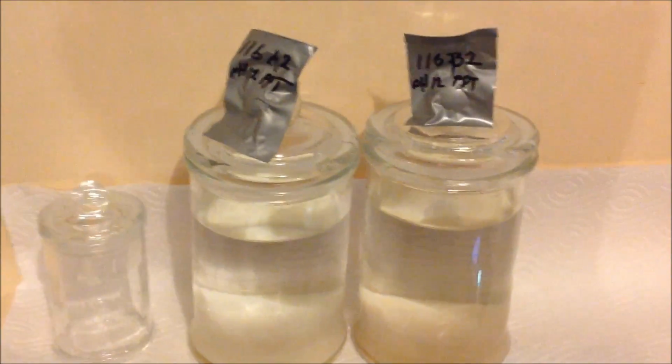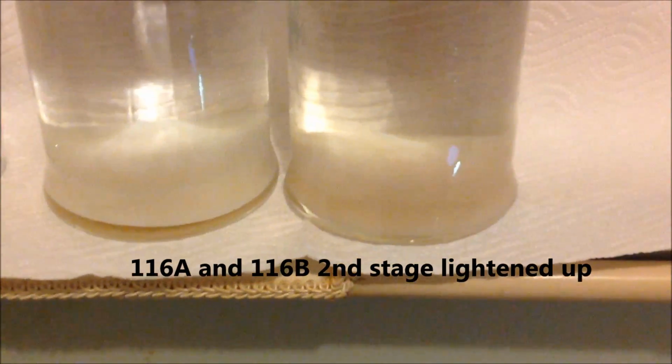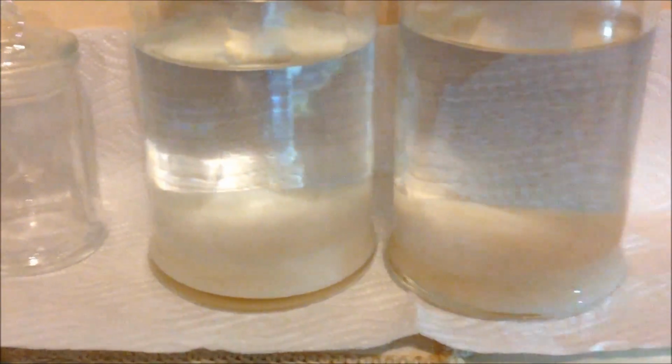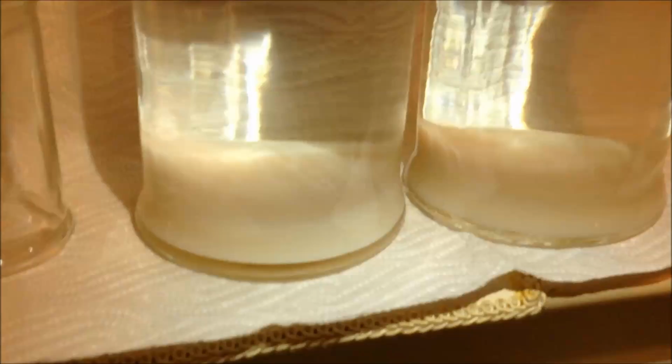A and B have cooled down overnight, and what's immediately striking is that B has gone from the darker brown to almost a white, and you can't help thinking if we had heat treated it another 5 or 10 minutes longer. I'll just play some light off that from my iPhone, you might get a better idea. That's very white.